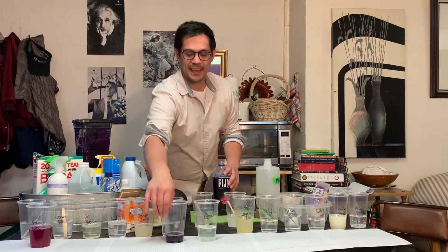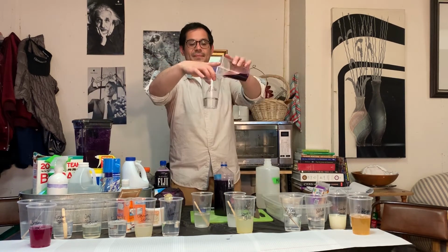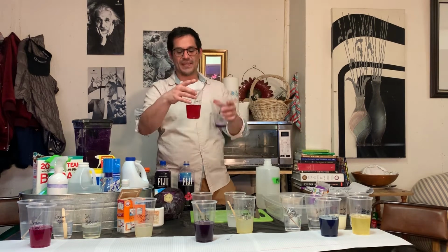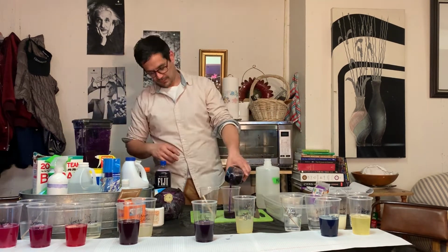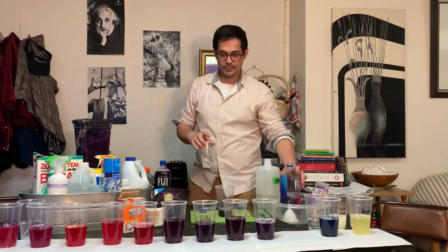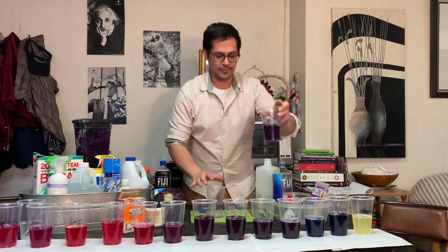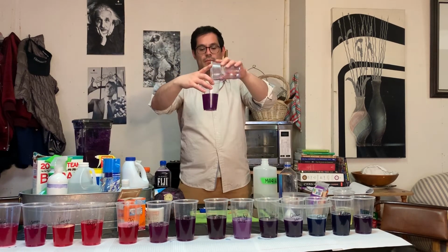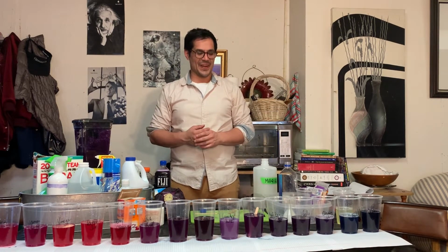So we'll keep doing. Boom. And there you go. So there are our results.